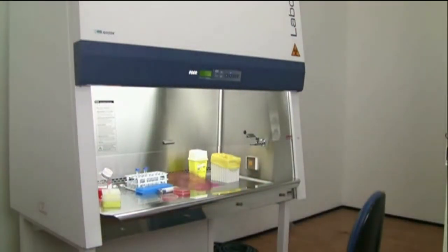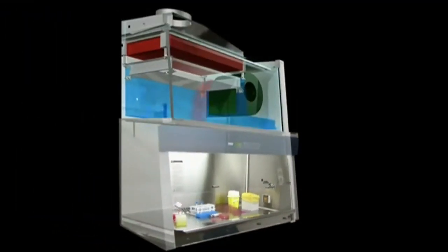Allow the cabinet to keep running as it will contain aerosols that may have been generated and will purge aerosols through the HEPA filter.